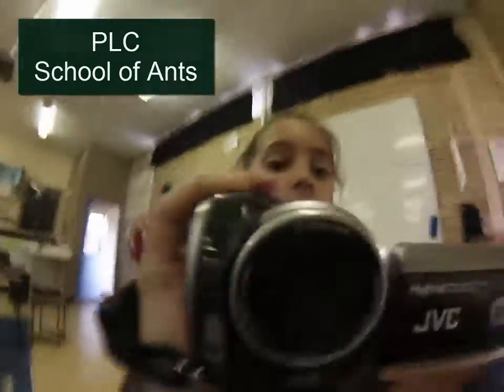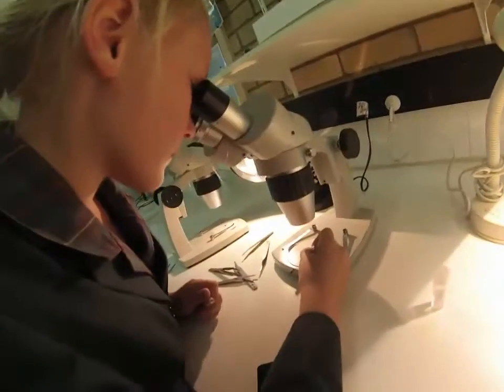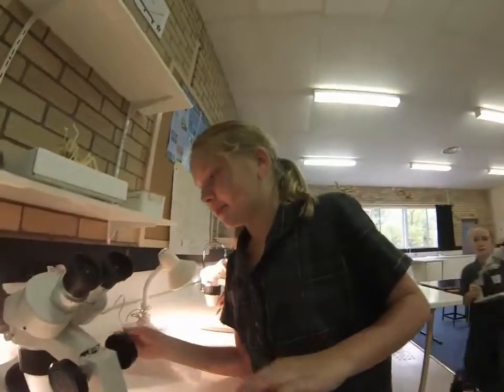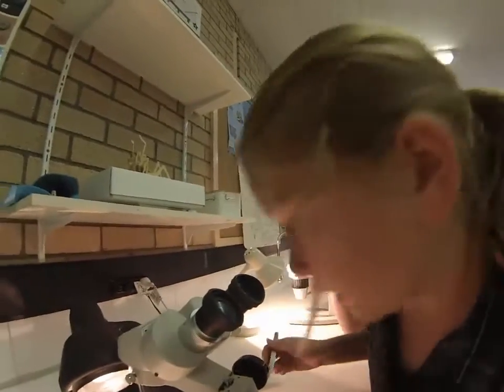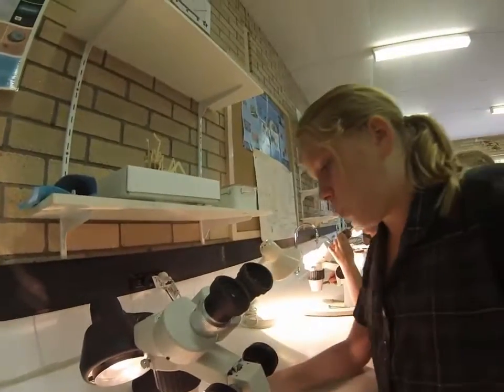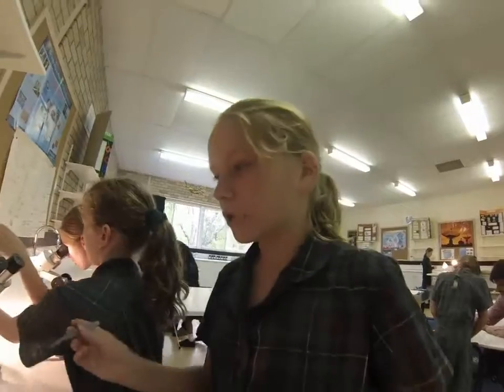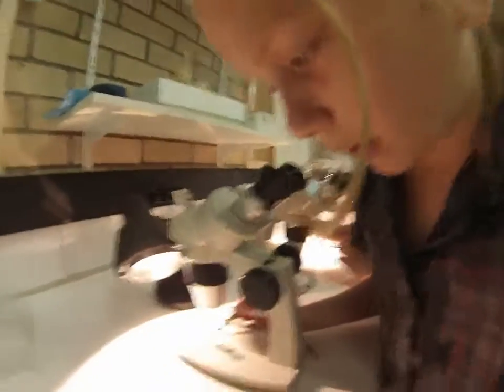It's not open. So right here we're placing ants under the microscope. Right now I'm just trying to find out whether it's got two petiole nodes or one, so I'm just trying to get it into the microscope.